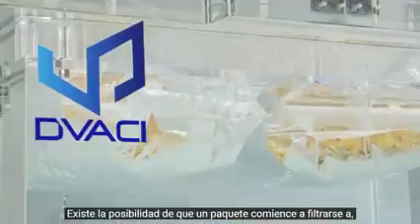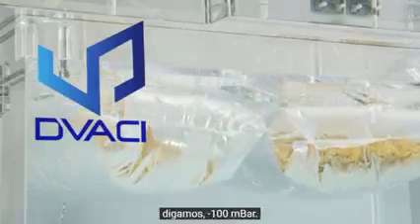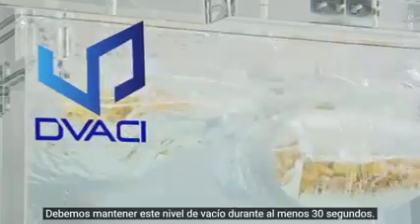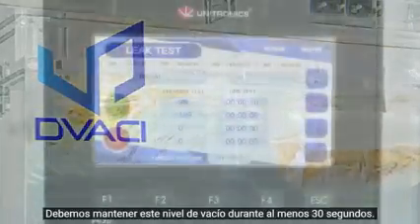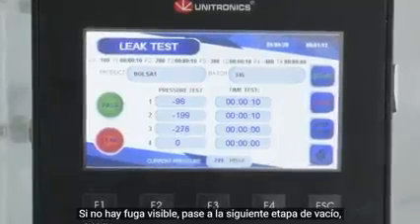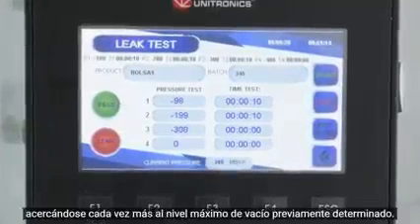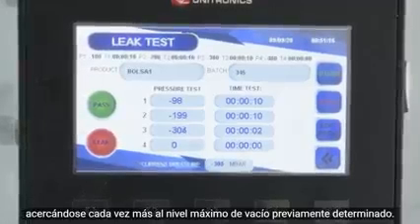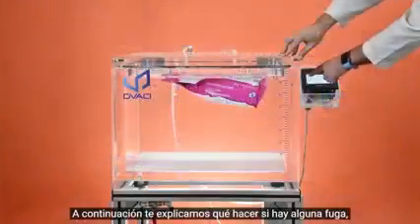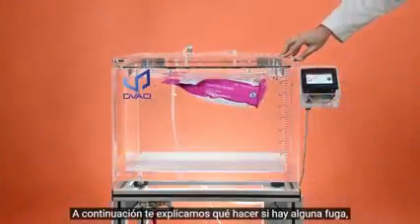There is a possibility that a package starts leaking at, let's say, minus 100 millibar. We should maintain this vacuum level for at least 30 seconds. If there is no visible leak, move on to the next vacuum stage, each time getting closer and closer to the maximum vacuum level previously determined. Next up, we will explain what to do if there are any leaks.